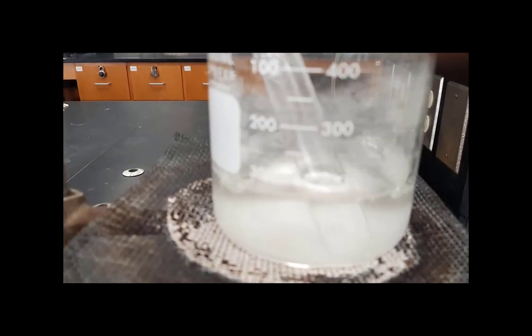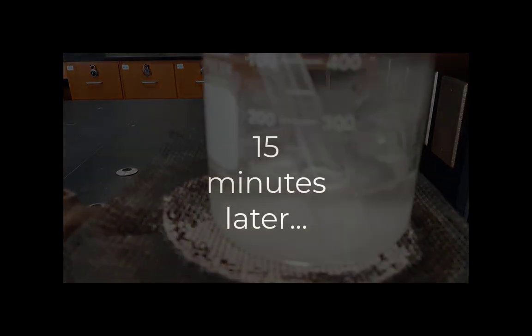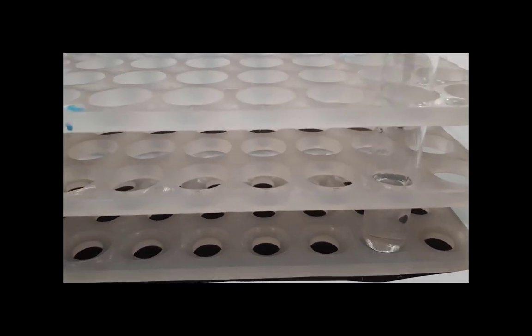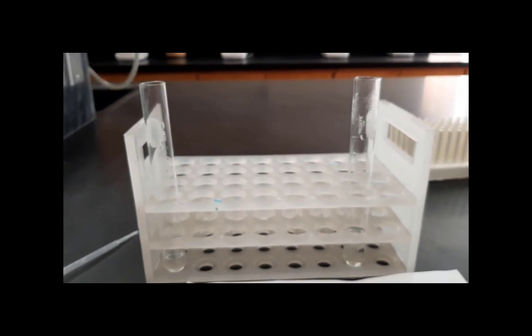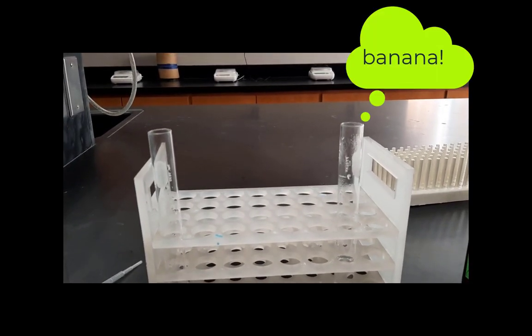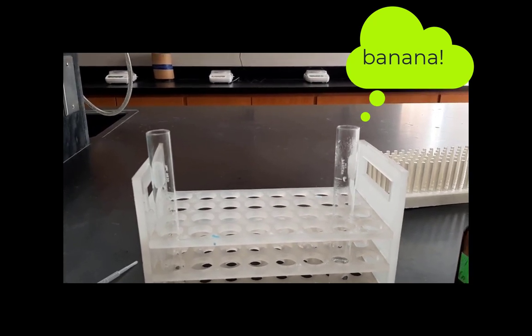After thorough mixing, I put the mixture in a hot water bath. After 15 minutes, I allow the mixture to cool. Once it's cooled, I can tell that there is a very distinct odor given off by this ester. It is the pleasant smell of banana.